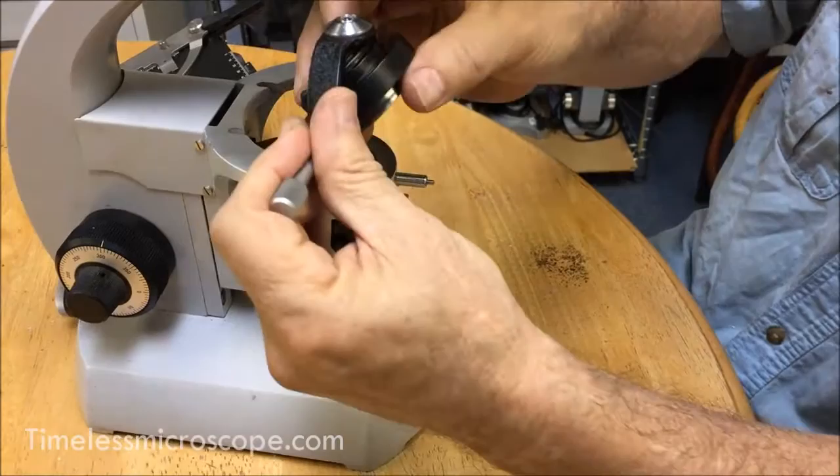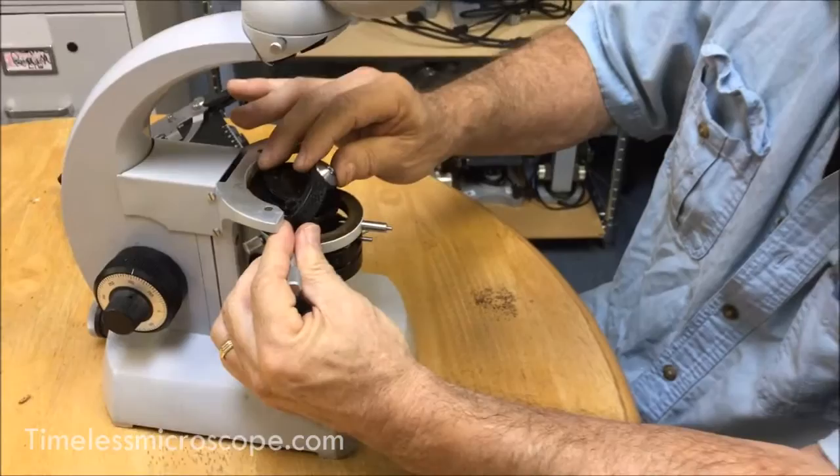Remember, you've got a little dovetail here. That's what you want to push against at the front — you want to clear that front area like this. Push against it and drop it down. That's simple.